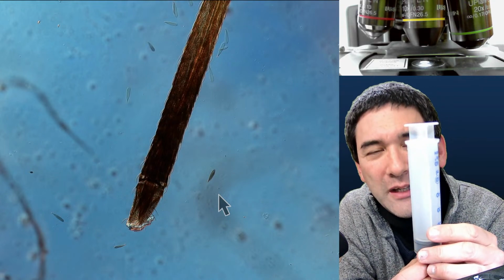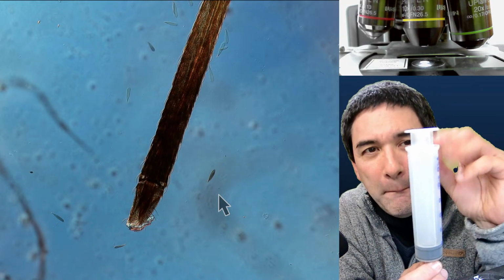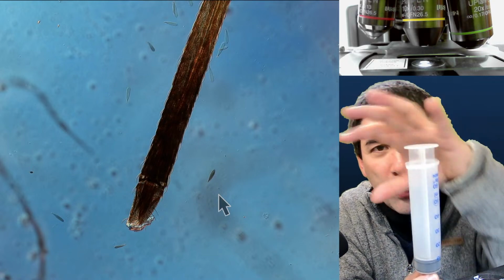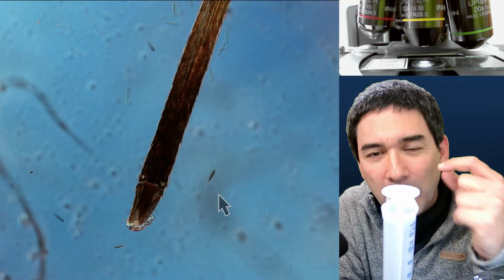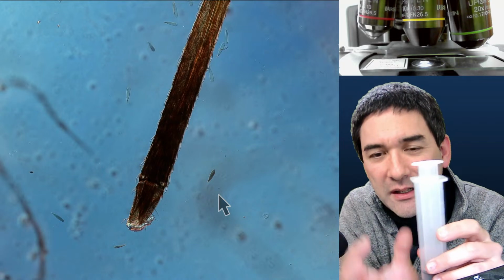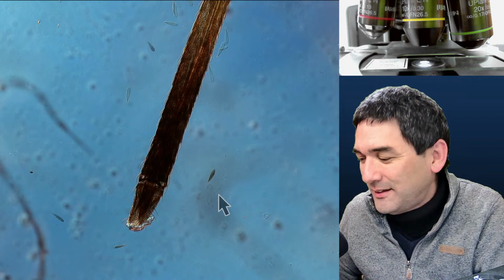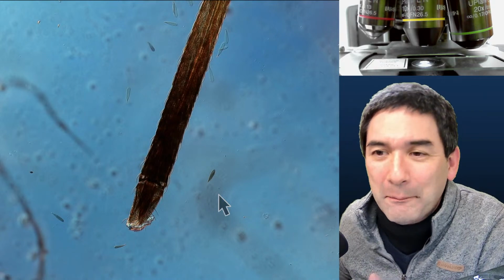Each one of them has a very simple lens-type structure in there, but it is not like there is one lens like we have in our eye. Actually there are several elements that are kind of joined together. So that's a very simple explanation.